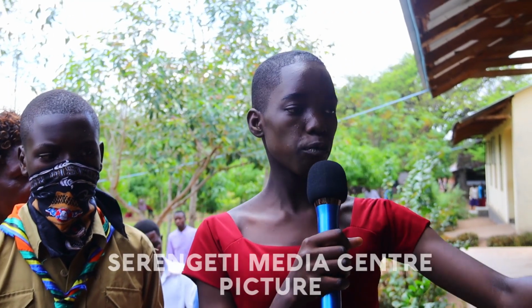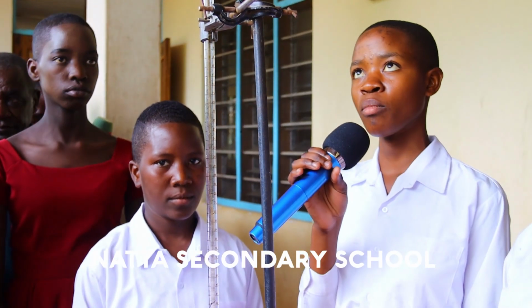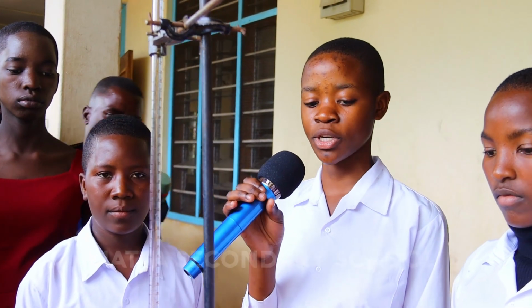We have experimental volumetric analysis. Here we have prepared different types of experiments which we can use in producing fire. We can start over there. Welcome. From the topic of volumetric analysis, about titration.